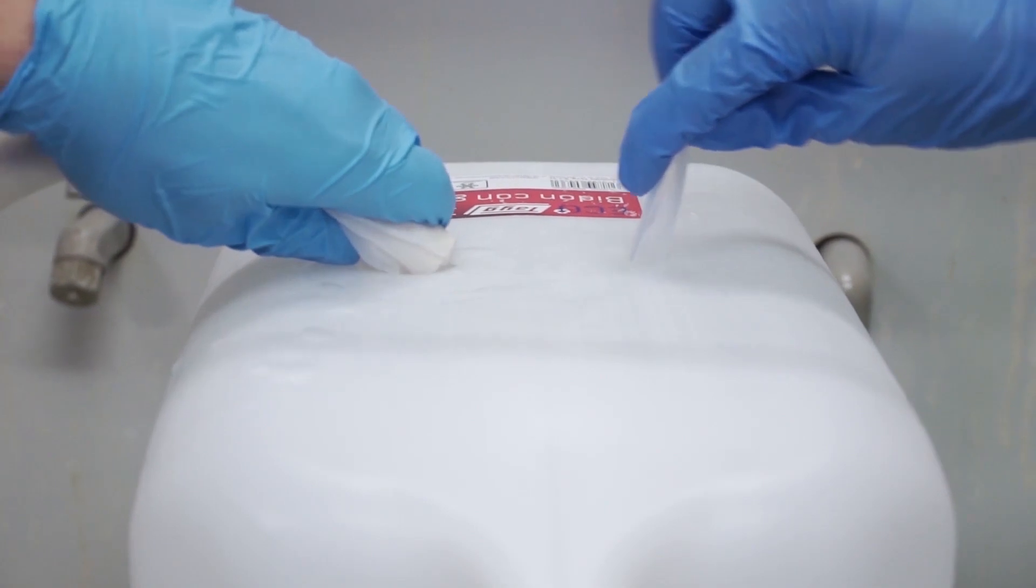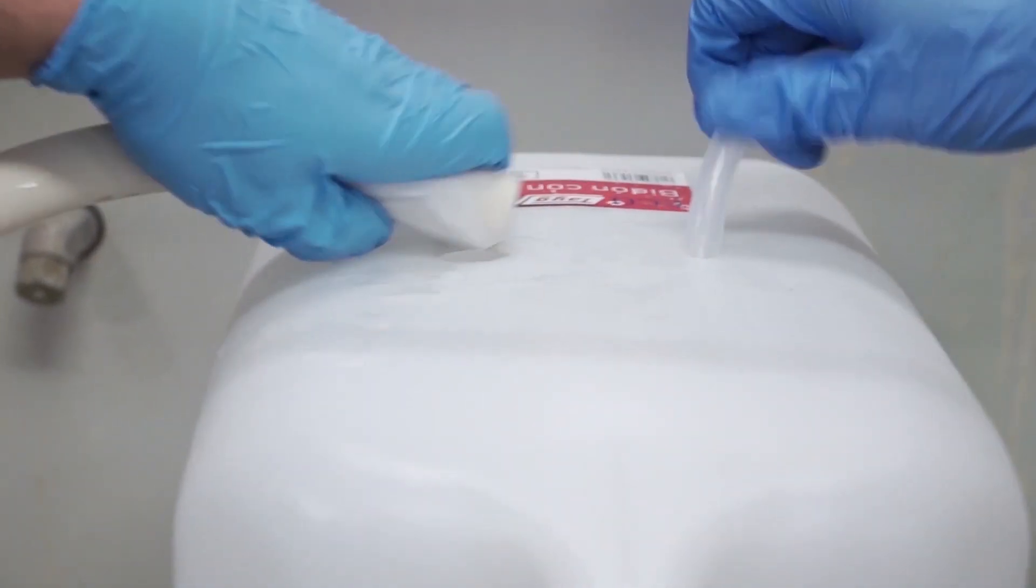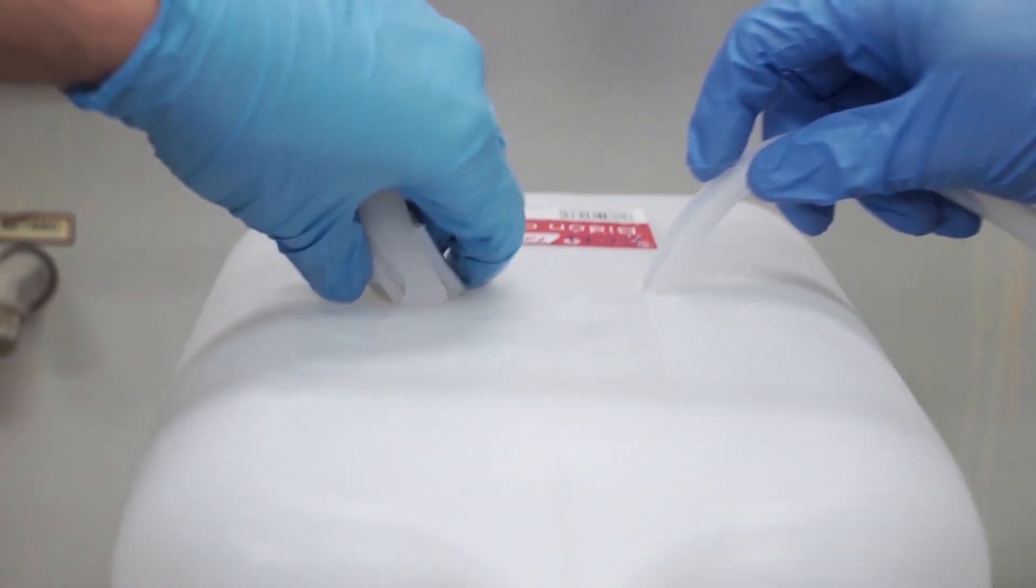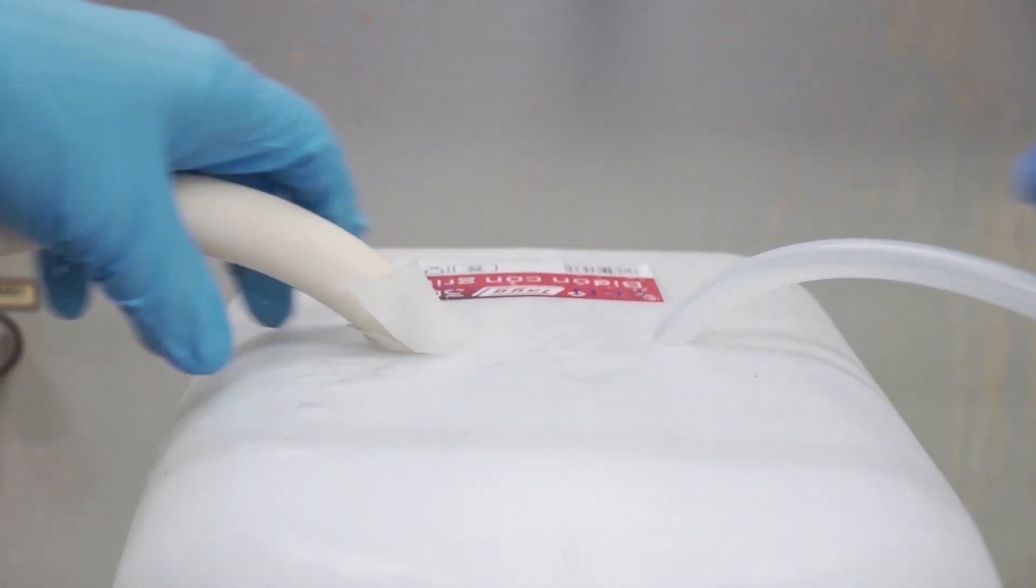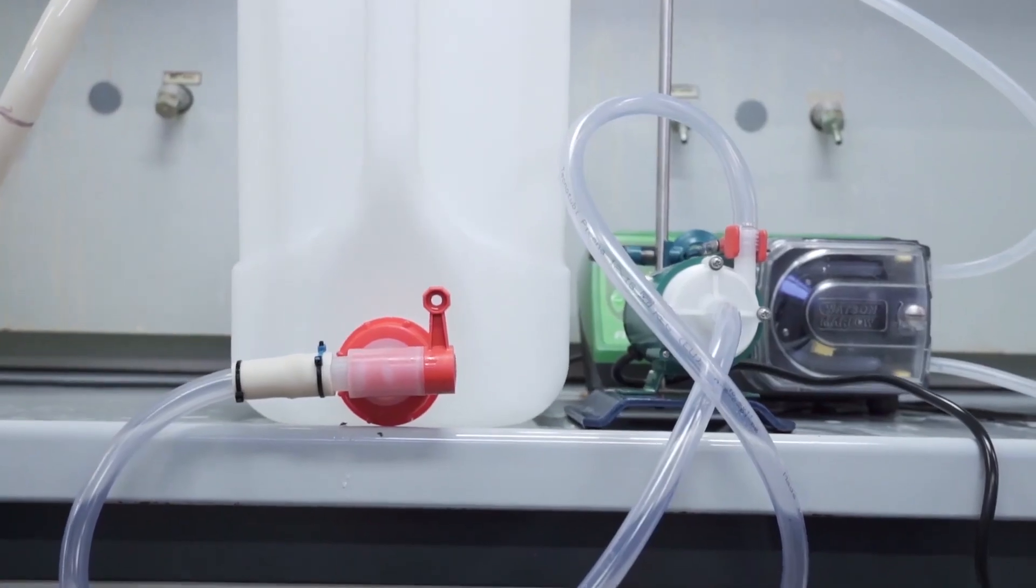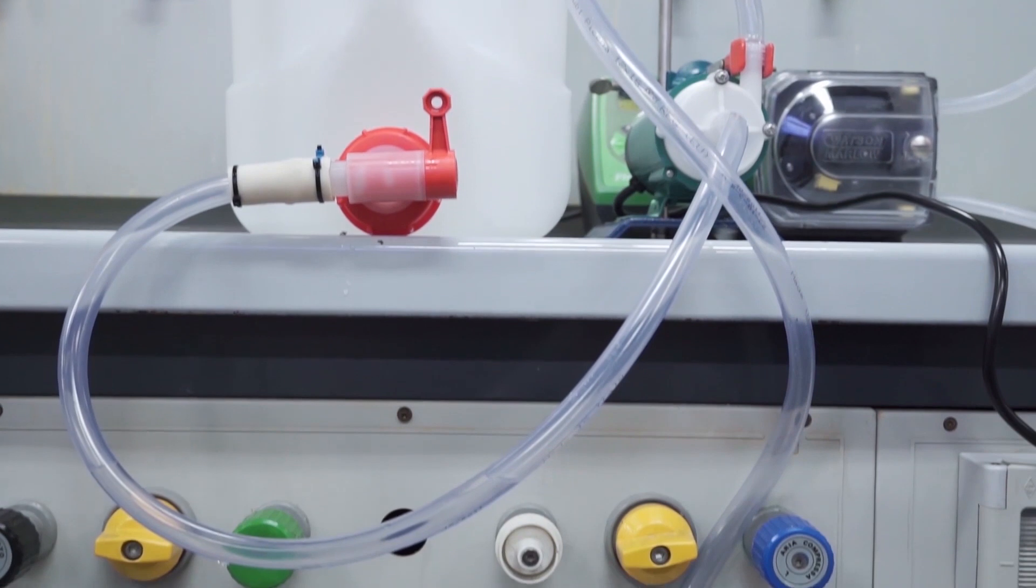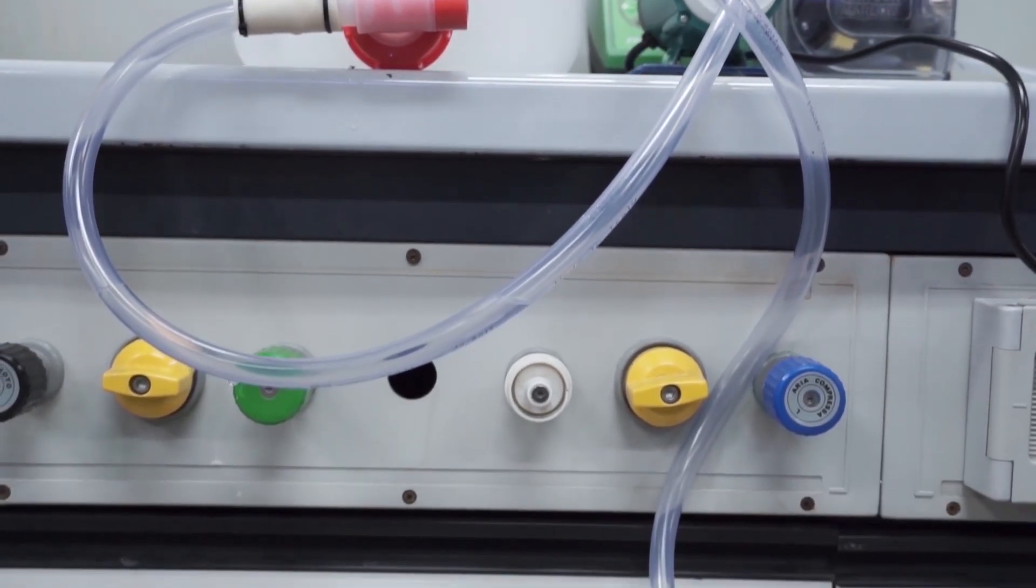At this moment, having gathered the tubing that can sustain the desired flow rate, insert them into the holes on top of the mixing tank.